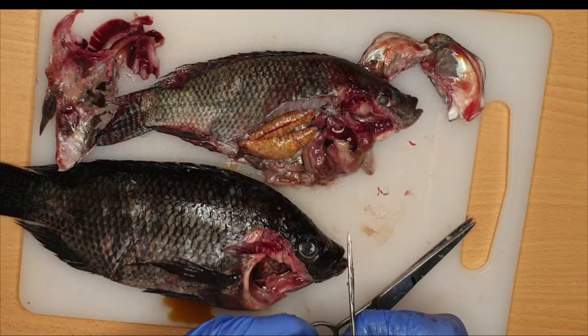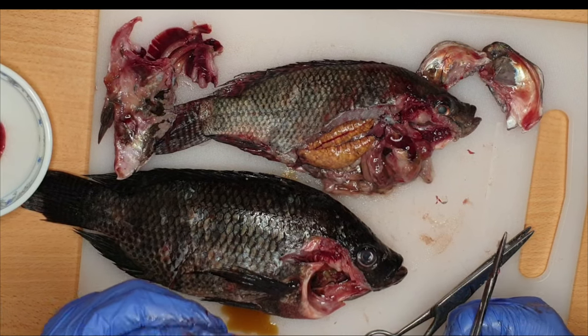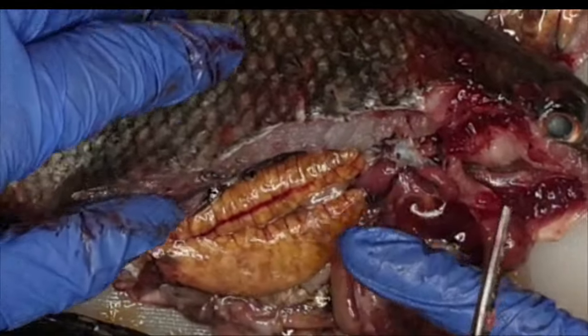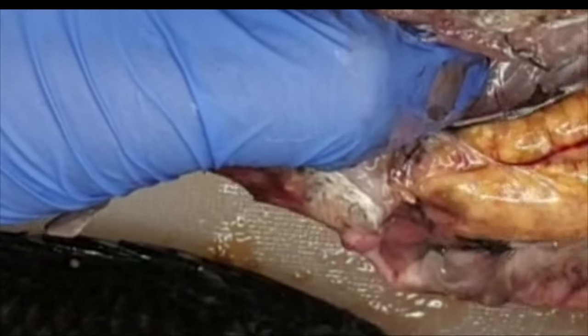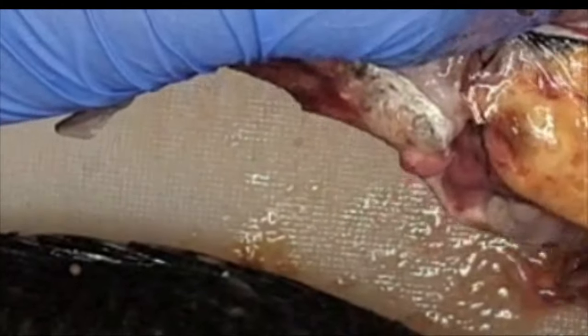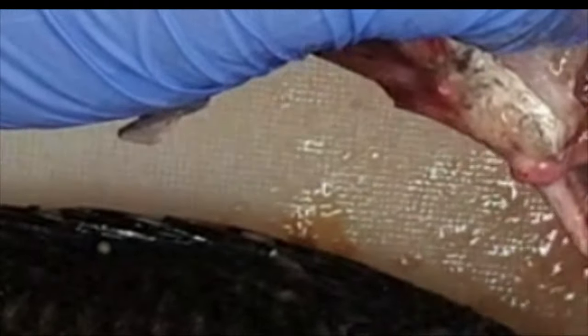One of the most important things here is the gonads. These are the gonads. This is a female fish, and those are the eggs that are inside the female. Of course, those eggs are externally fertilized, then they will grow and hatch outside of the body. This is the female ovary that contains a huge number of eggs.